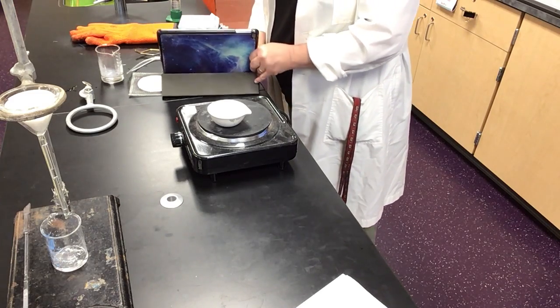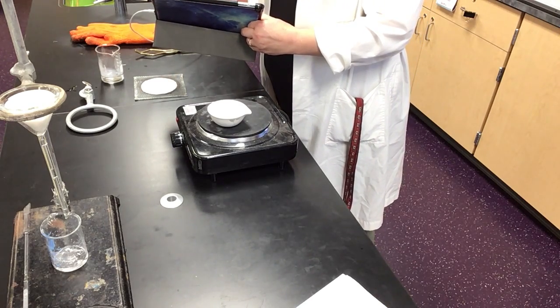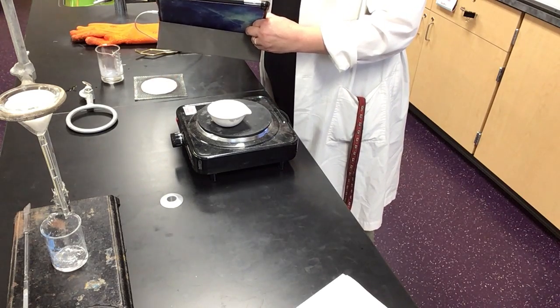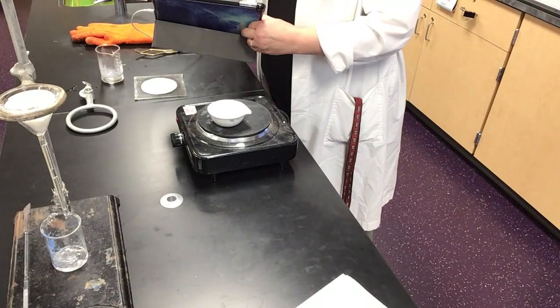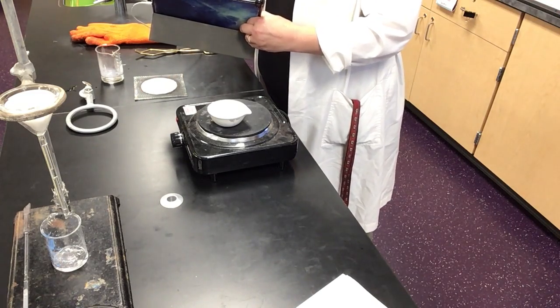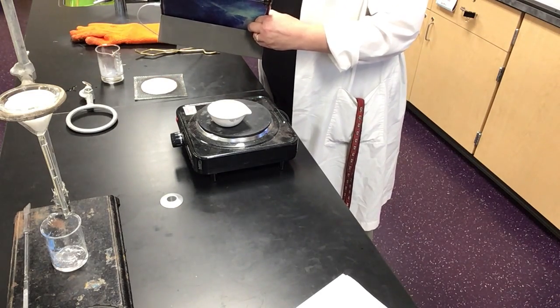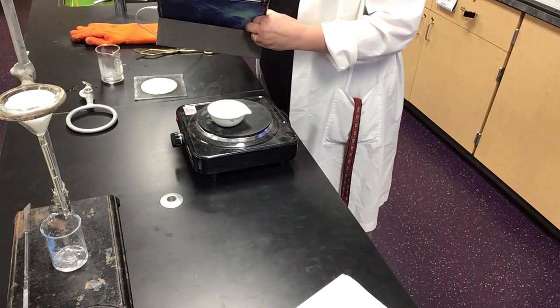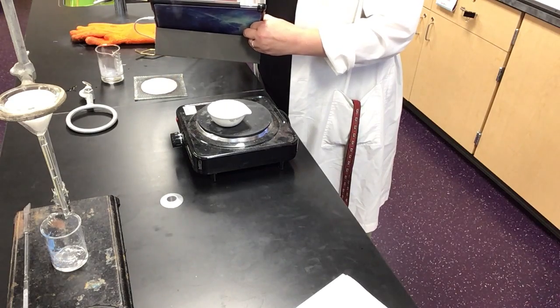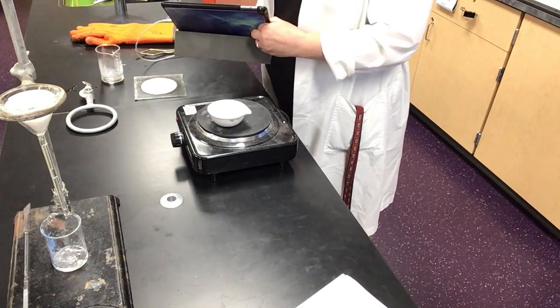And actually, from up here, you can't see them flying so much, but you can see that the burner is starting to look like it just snowed. There are little flecks of white that are appearing on the burner. Those flecks of white are salt. That's your material, and you're losing it. So if you're charged with recovering all the material and not having error, you got a problem, because every single one of those little flying missiles of salt is a chunk of material that you're never going to recover.